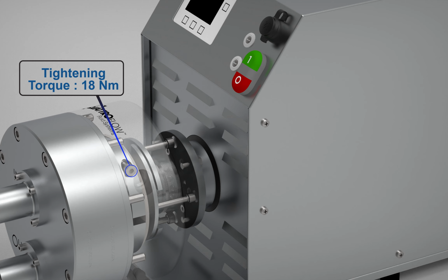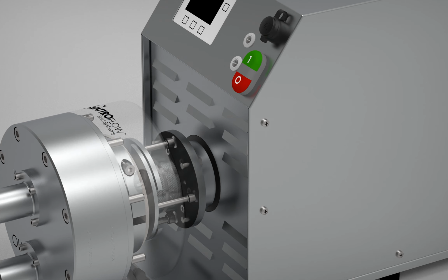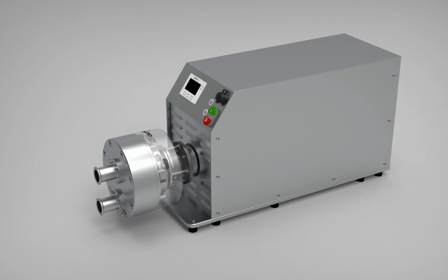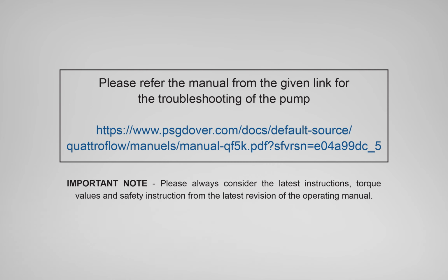Fasten the clamping ring screw, with the torque of 18 Nm. Fasten the locking screw. Please refer to the manual in the link given for the troubleshooting of the pump.